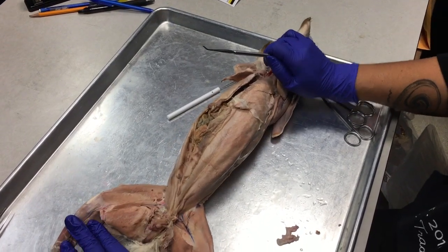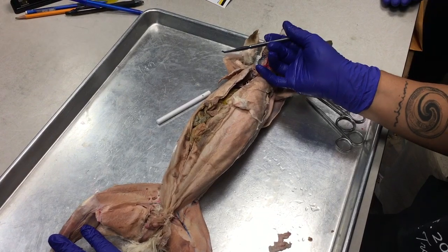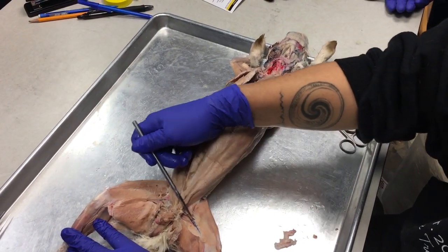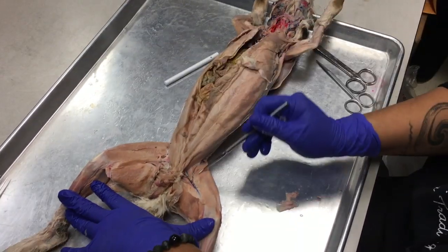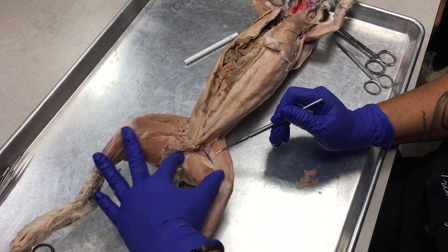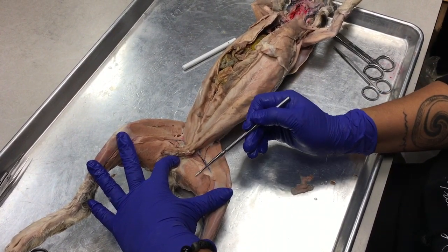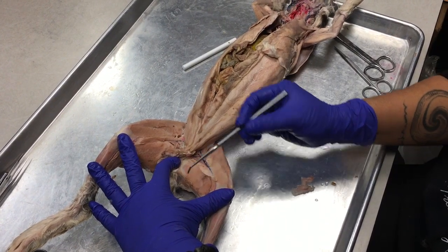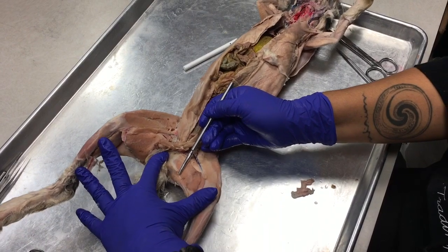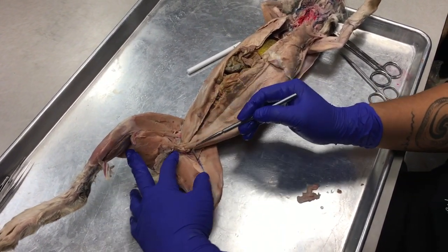So moving toward the thigh muscles, we have several muscles that sound familiar. So first of all, there's this big sheet here on the upper portion of the leg. That's your sartorius. Then the bottom sheet is the gracilis major. And then again, we have this little gracilis minor at the hamstring area of the bunny.